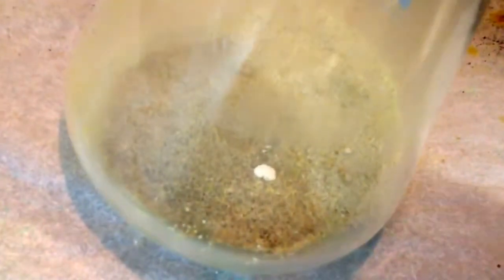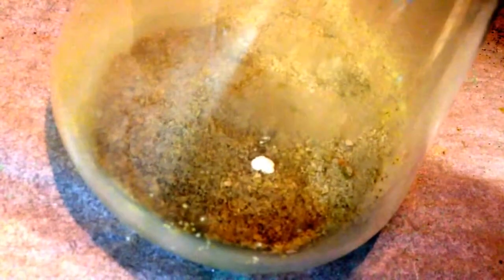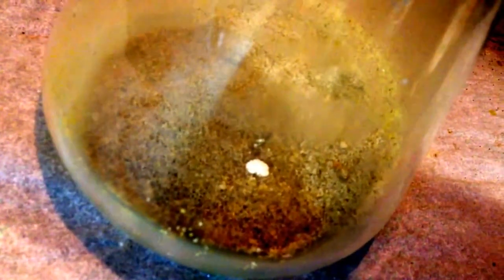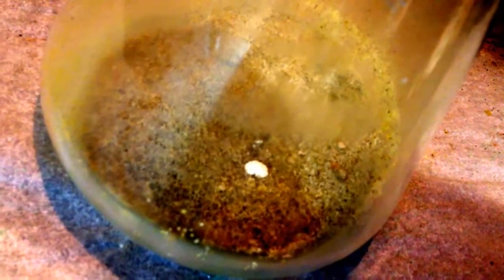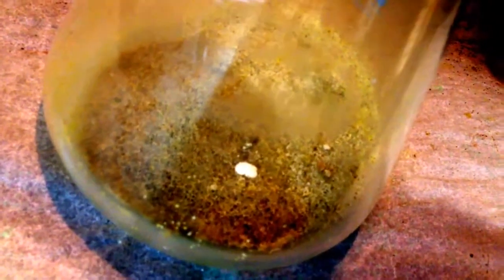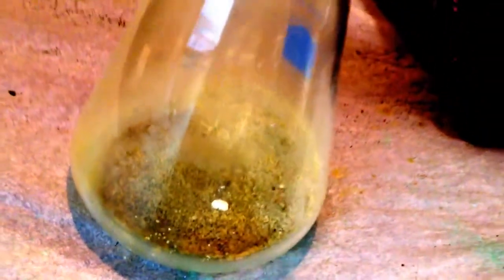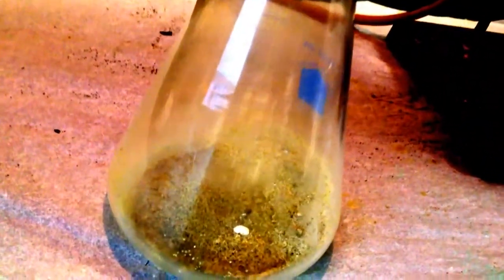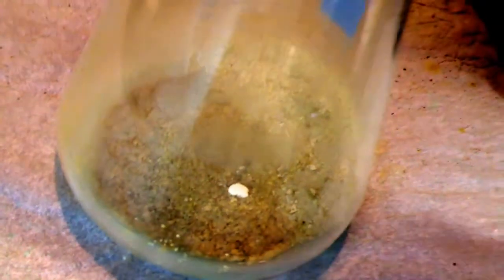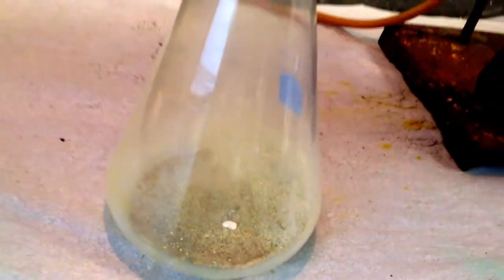So let's zoom in to some very close space, and you will see right there, as I focus, that is where the sodium chloride is in the place of where the sodium metal was. So the sodium atoms gave electrons in a redox reaction to the chlorine atoms, and became sodium plus ions and chlorine minus ions. And they attracted each other to form this precipitate, or salt. And that was that cloudy white substance.